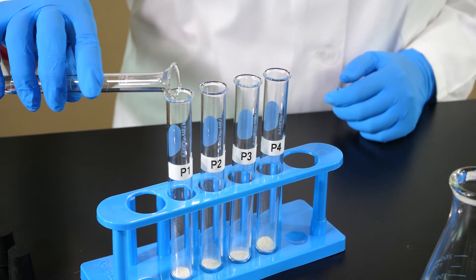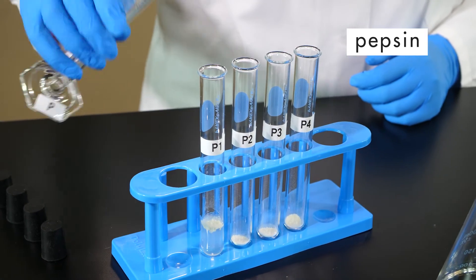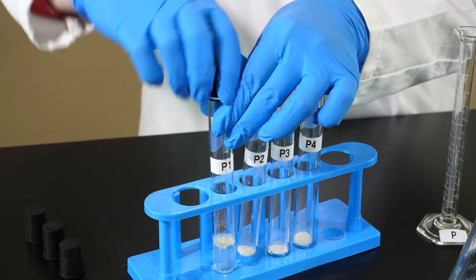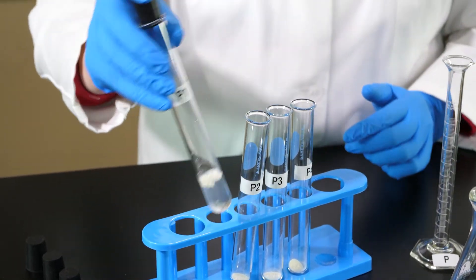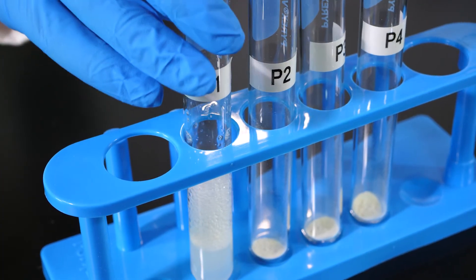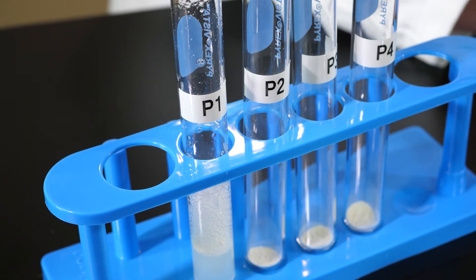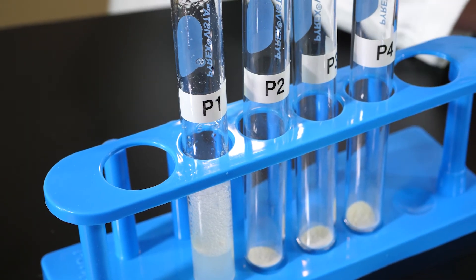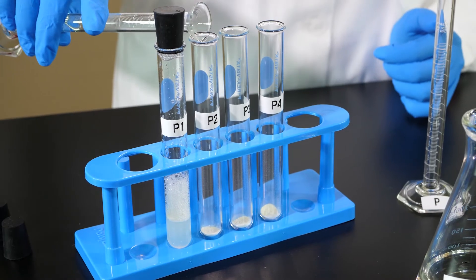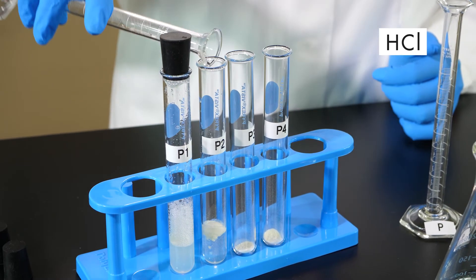We add 5 ml of the pepsin solution to the albumin in test tube P1. After placing the stopper, we swirl the test tube until the albumin powder dissolves. The fact that the albumin powder has dissolved does not mean it has been digested. Even though we cannot see the albumin, protein molecules are still present.